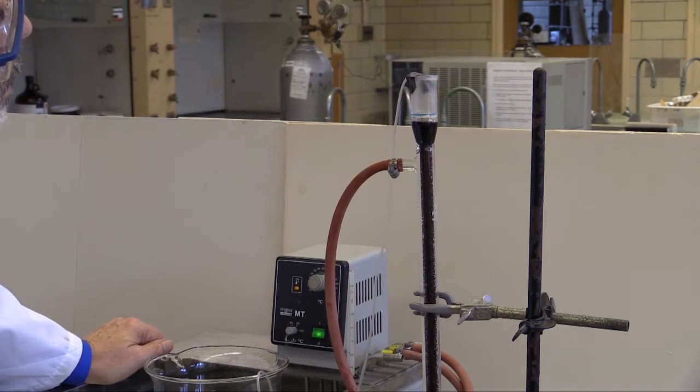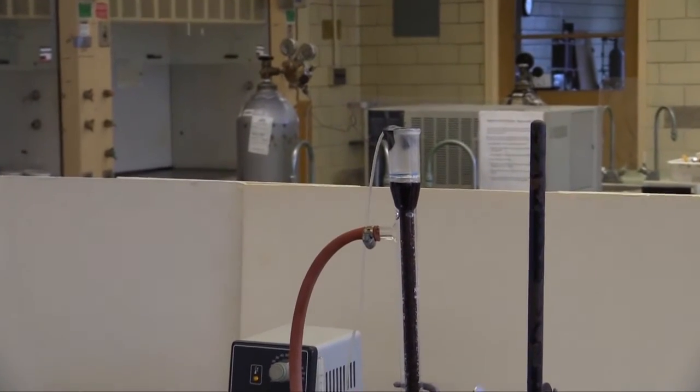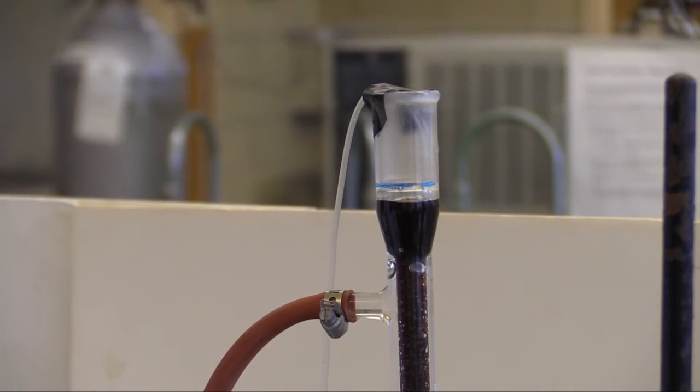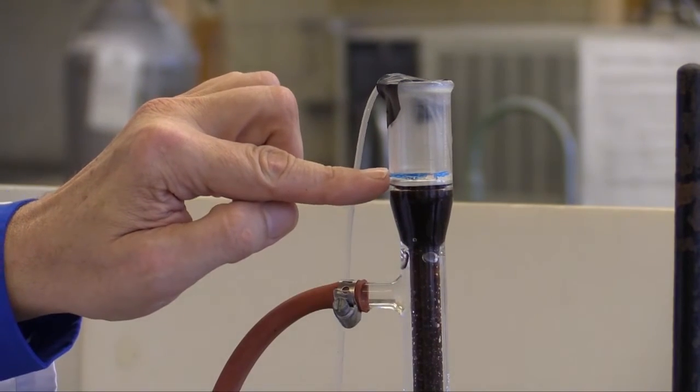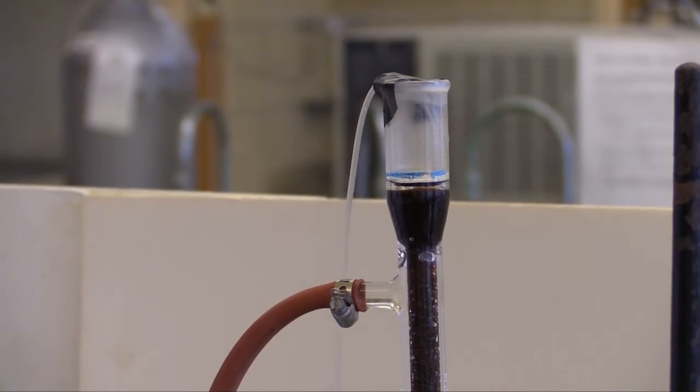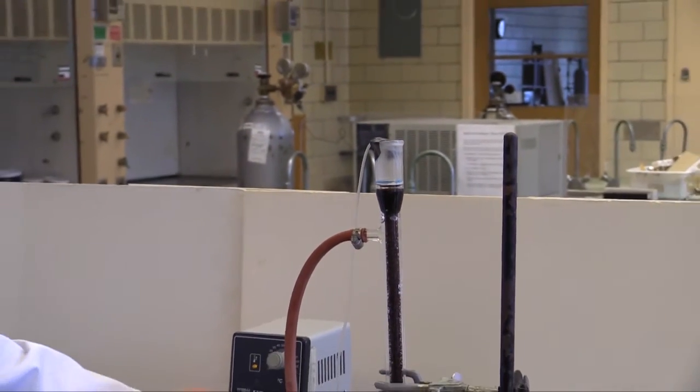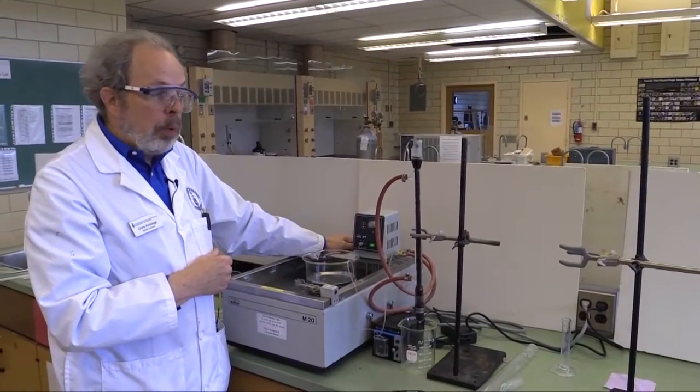Now, I need it to be a little faster than it is at the moment because I don't want this to dry out. So there's a blue line here. You want the level of liquid above the reactor to stay approximately there. I'm speeding the pump up so it's delivering more liquid as we go. Now, it may be that you don't hit the right speed initially and you have to adjust this during the run. That's not significant as long as the height of the water column is approximately the same. The flow will be approximately the same through the reactor. And now this is ready to go once you have checked that everything is at 60 degrees. And you now let this come to steady state. That will take about half an hour. And so while that is happening, we will pack the second column.